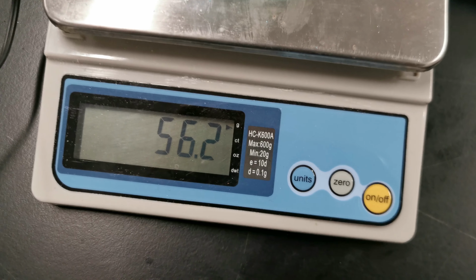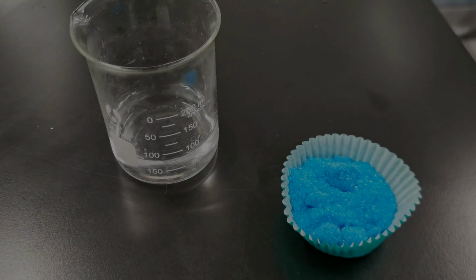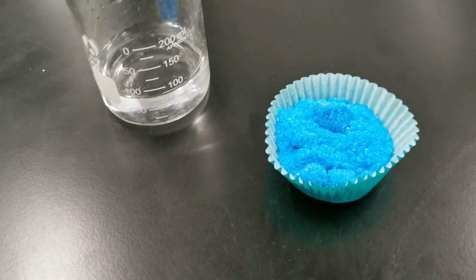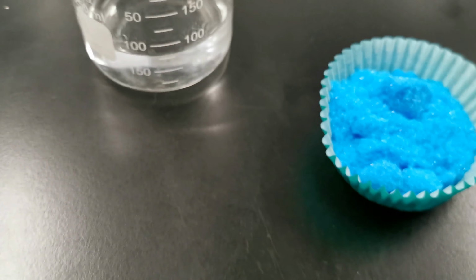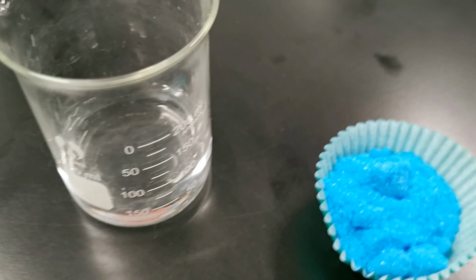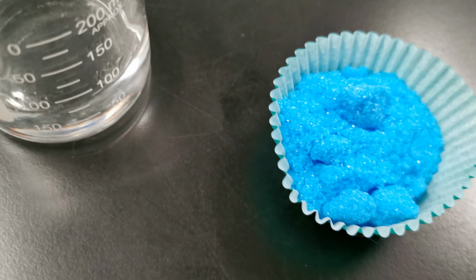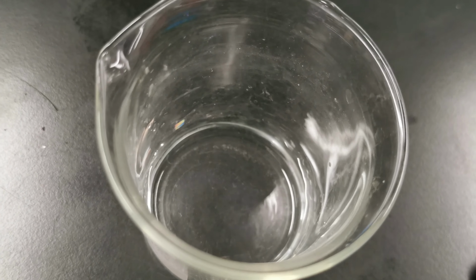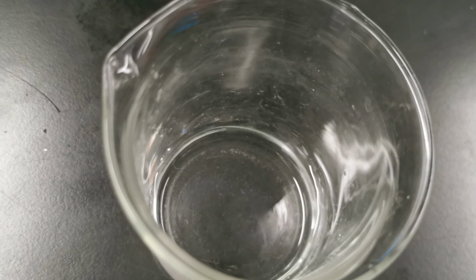Now we're going to dissolve this in some water. Right, so we have some water to dissolve the copper-2 sulfate. We don't just have some water, we actually have 75 mils of water. The solubility of copper-2 sulfate is about 20 grams per 100 mils, but that's at 20 degrees Celsius. Now, we want to get this water boiling. We're going to make a nice hot saturated solution, so we can cool it down and have some of the solid form. We want to form some crystals.